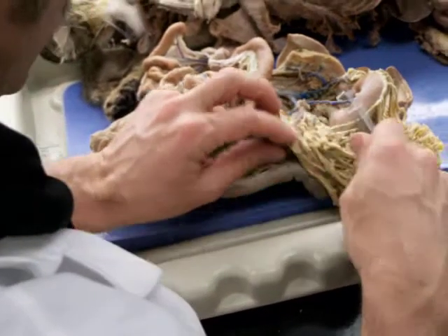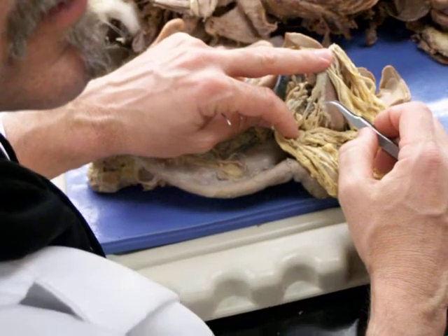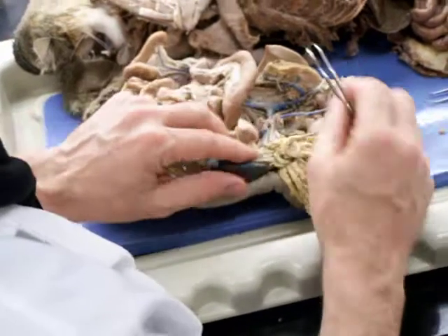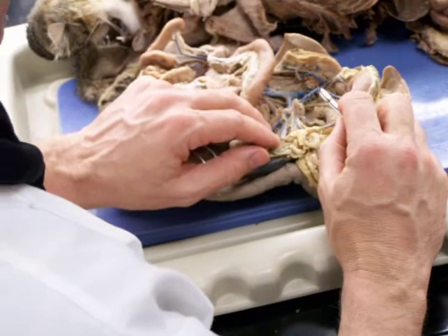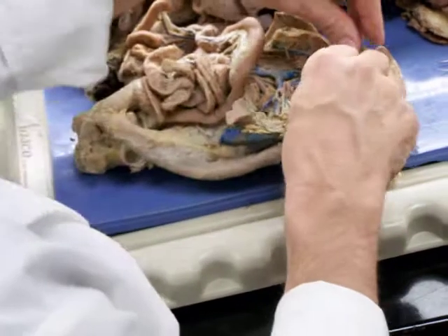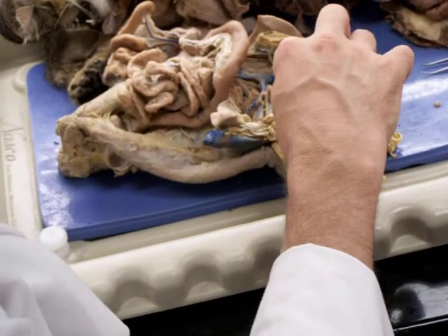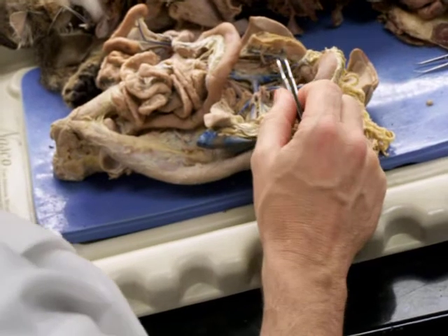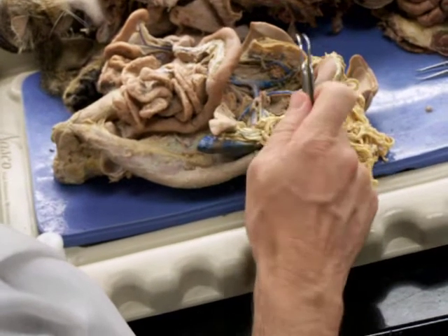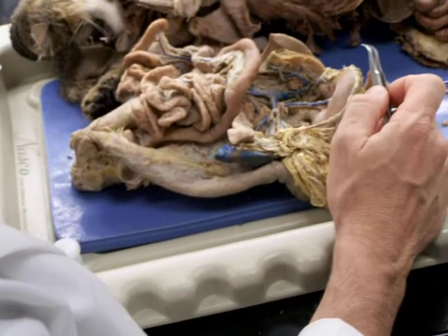And those are going to get left gastroepiploic veins from the left portion of the greater curvature. It also gets a left gastric vein, which is coming from the left side of the lesser curvature. That's this right here. And that's why it's called the lienogastric, because it's draining blood from the spleen and from the stomach through that left gastric and the left gastroepiploics.